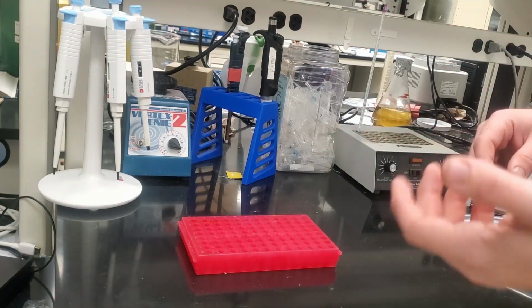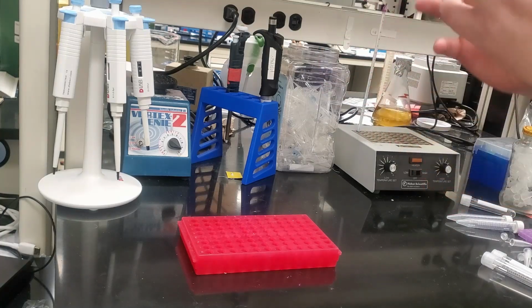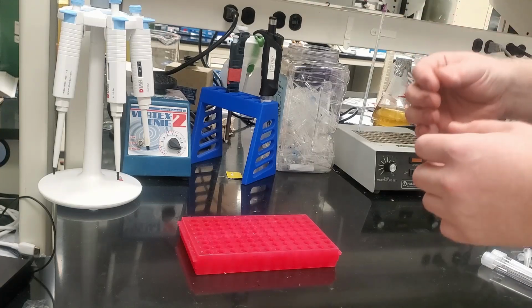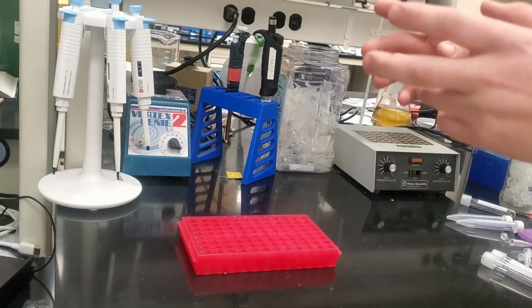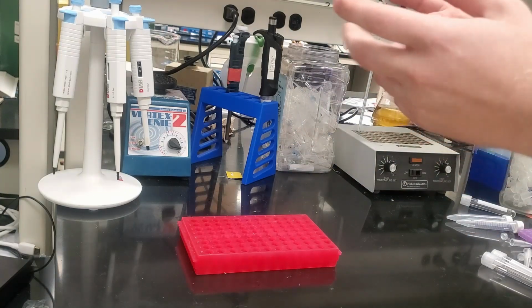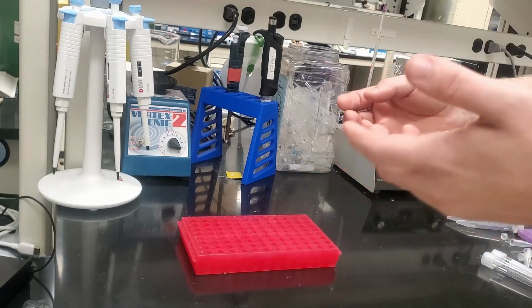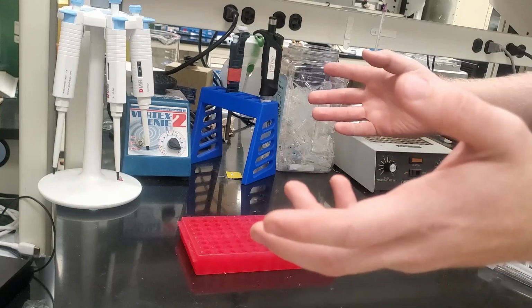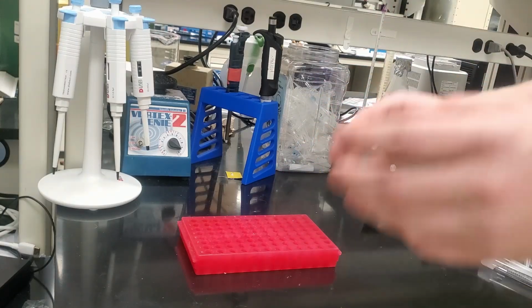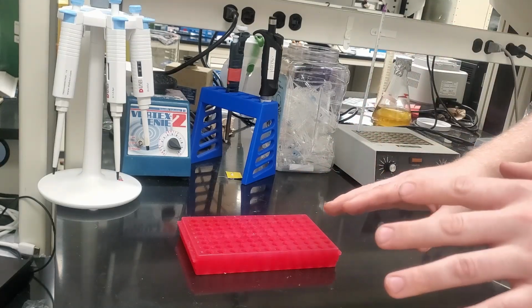Kind of. You may notice we're not starting in our normal place this time. We're starting right in the lab. That's because I've decided to make this video completely backwards. Having looked at my most popular video and realizing that what it's about is taking an overly complicated piece of lab equipment and making it simple and accessible, I decided to turn that whole concept on its head. And instead, we're going to be looking at the simplest possible piece of lab equipment and seeing just how far we can over-engineer it.